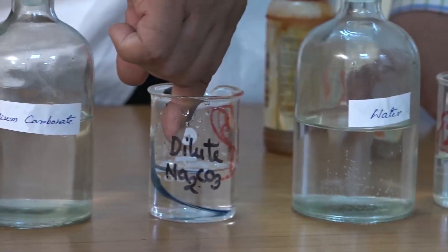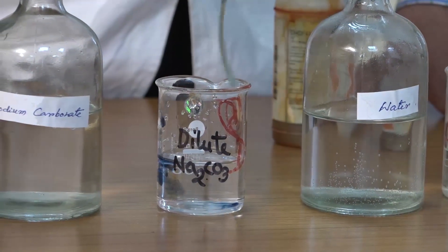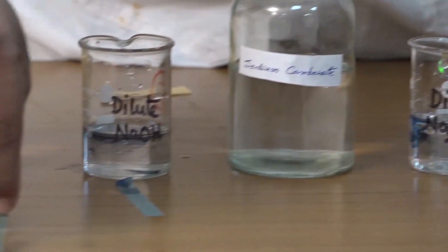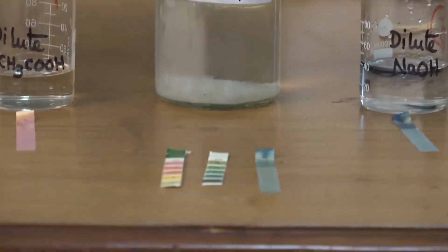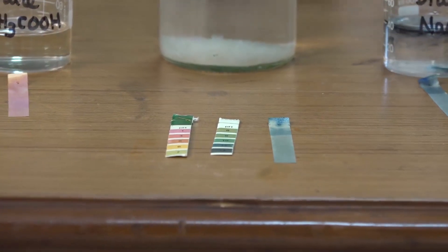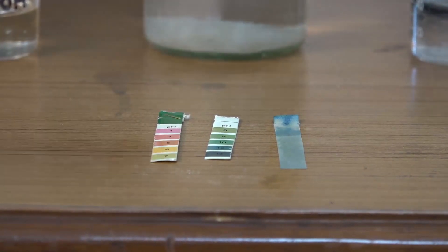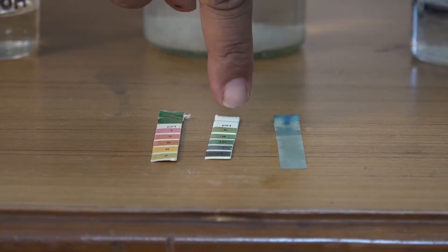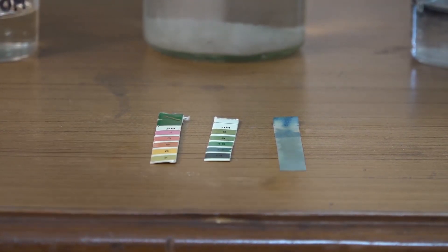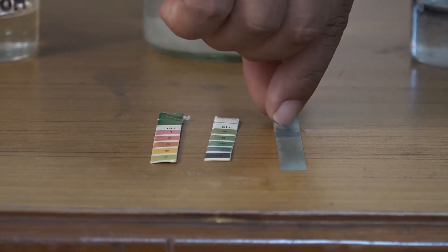Next I am collecting the pH paper from the sodium carbonate solution and matching the color with the pH scale. The pH is almost matching with 10 or 11. It is also more than 7, so it is also basic in nature.